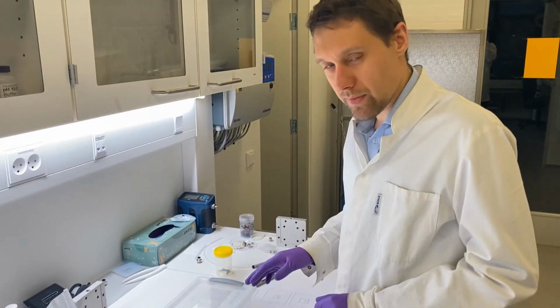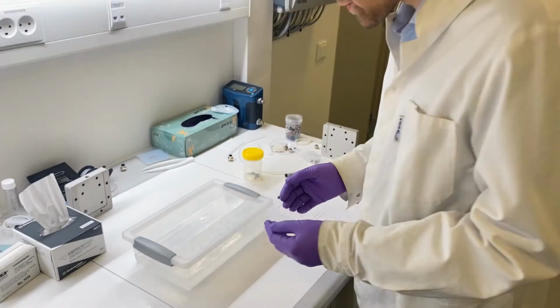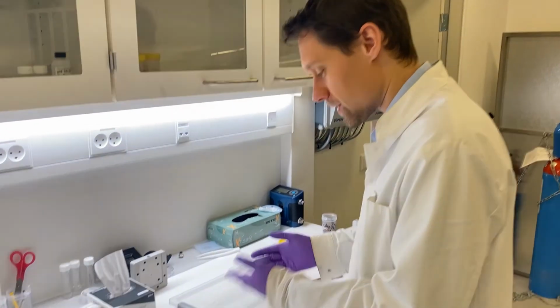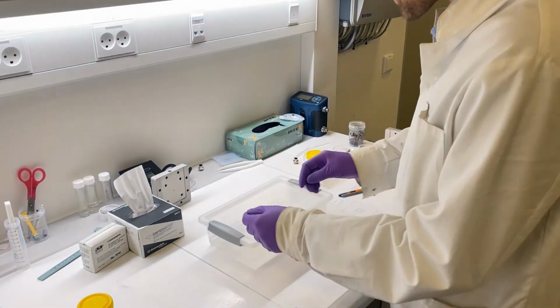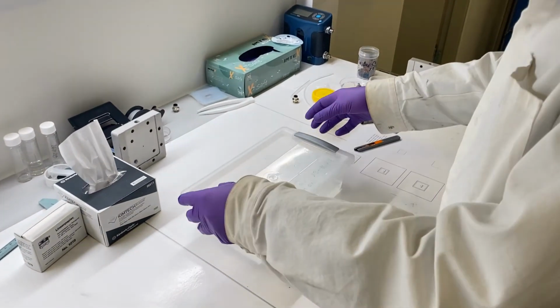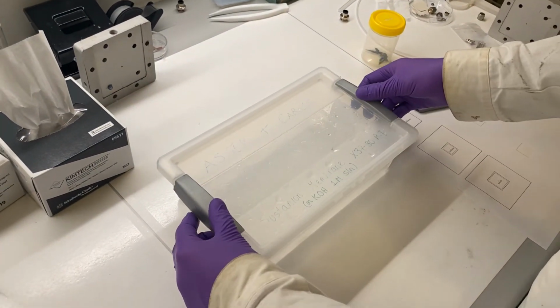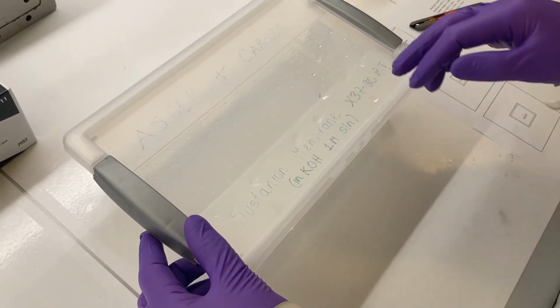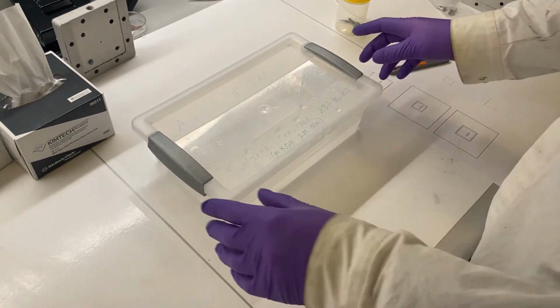Now we're going to cut out the membrane, and for this I now wear new gloves, because now I don't want any metals on either side, because I can of course not keep my hands only on one side of the membrane. So we keep the membrane, it's a Sustainion membrane we're going to use today. It has been prepared in 1 molar KOH, where it has been activated, and then we just store it here in water.